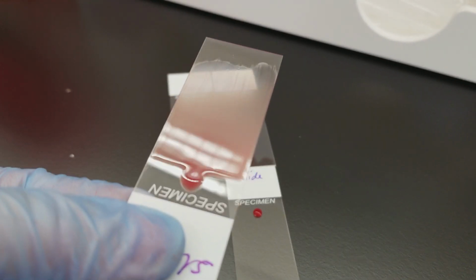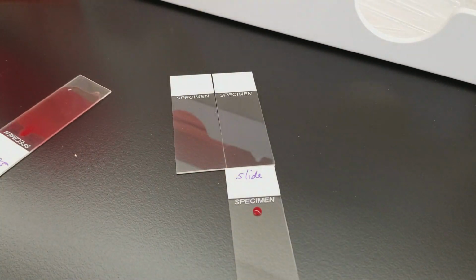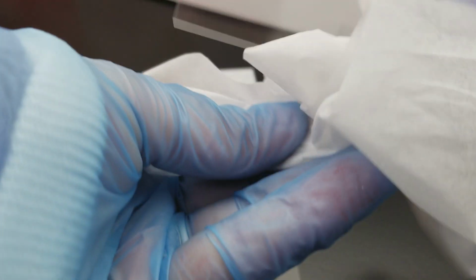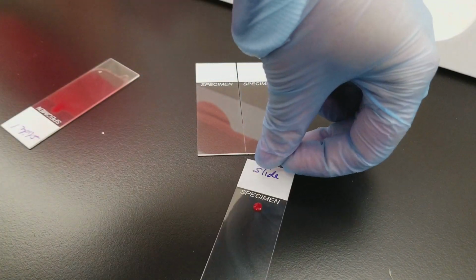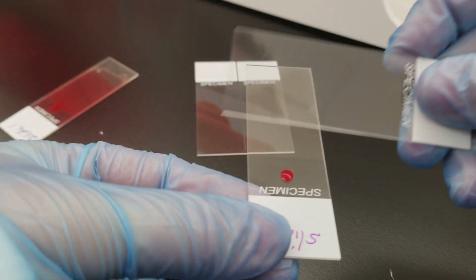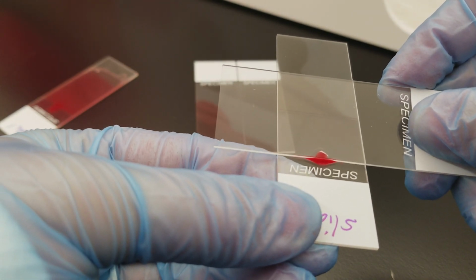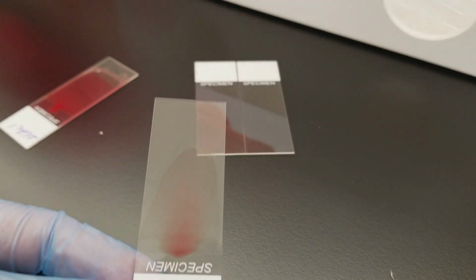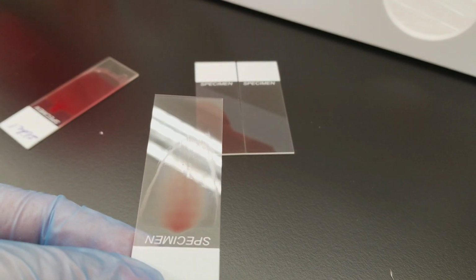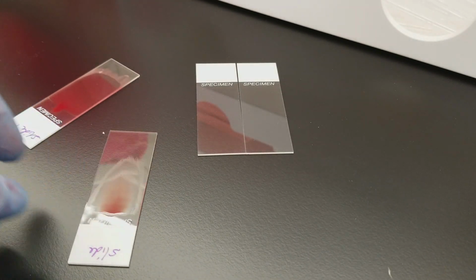But as we said, this one's going to be too big. So we will see how that ends up going. I'm wiping in between to keep my spreader slide clean. Sorry about that. And then I'm going to do this one too. Okay, so this one's more of a realistic size. We pull it back, let it spread across, and then go like that. All right, so we're getting a pretty good slide there. Yes, there are tails there, which is not good.